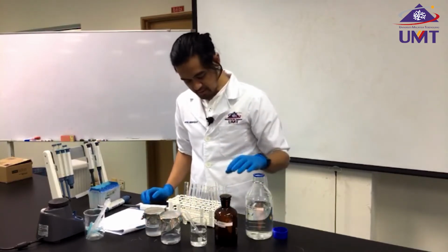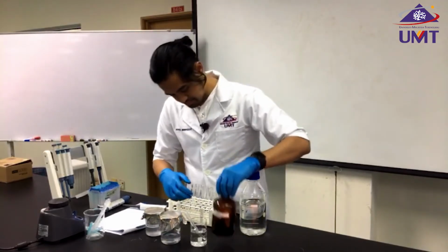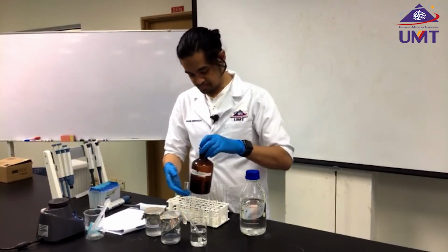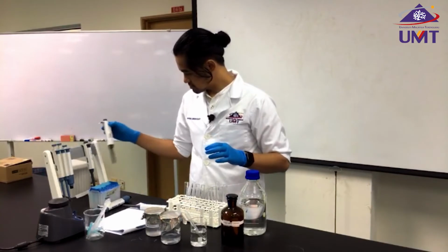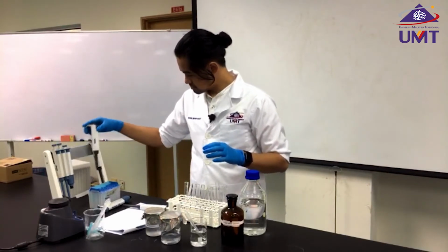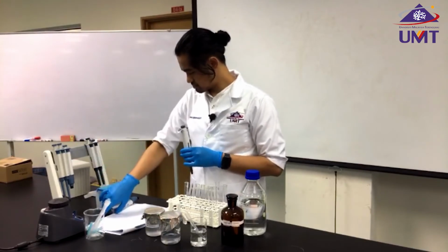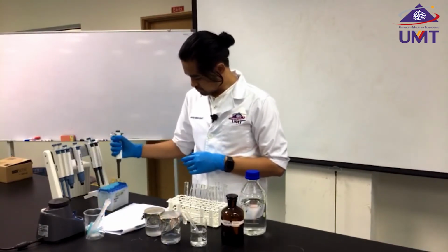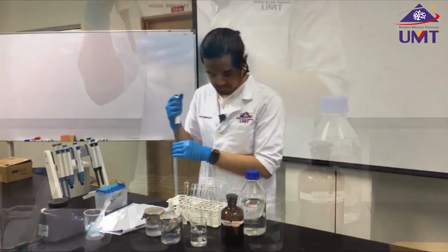And now I'm going to add acidic iodine into the tube. How much? 500 microliters.